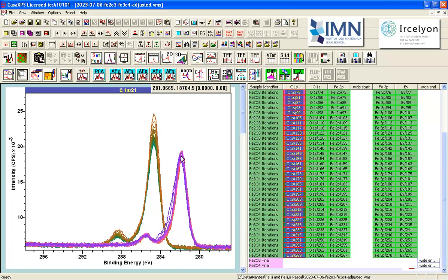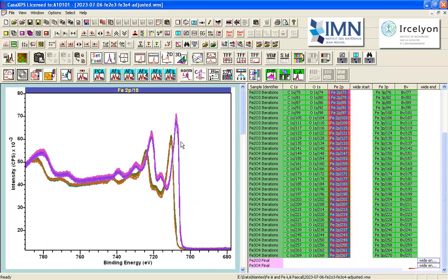So this has been offset, and that would be consistent with additional negative charge on the surface, accelerating electrons away from the sample as part of the emission process. And therefore, the apparent binding energy for the Fe2O3 carbon 1s is at a lower binding energy, higher kinetic energy. So we can see that the electrical properties of these two materials, two samples, are in fact different, even if the Fe2p spectra look very similar. The anomaly in these measurements is that the spectra do look very similar. In fact, the Fe2p is not the only photoemission line measured from iron.